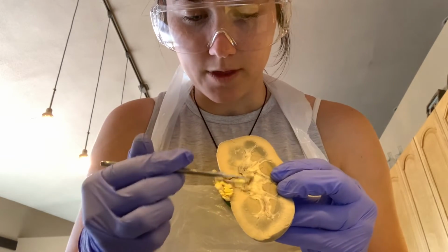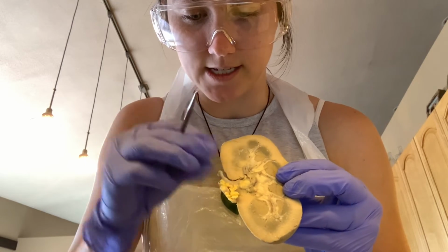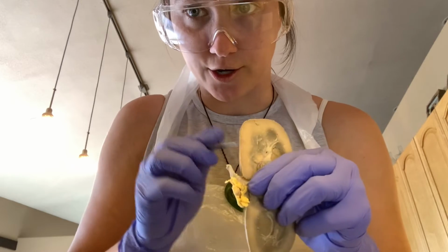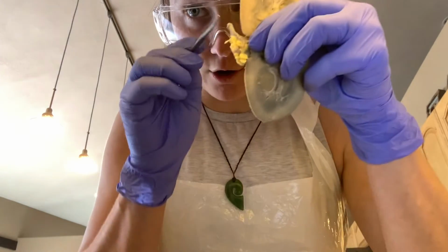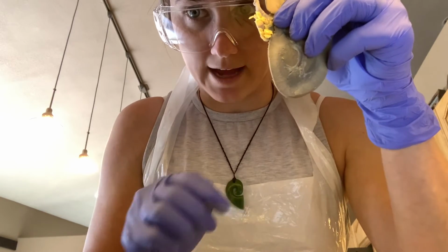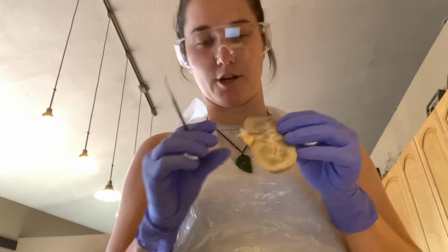So then from the renal pelvis, it exits the renal hilum, and it connects to the superior aspect of the ureter, which is here. And the ureter will eventually travel all the way down our abdomen and then pool into our bladder. And this is where the urine will be stored until micturition.